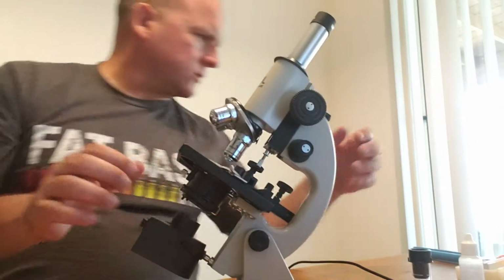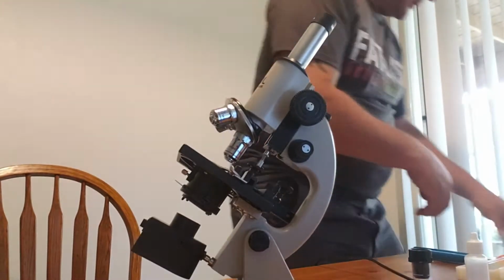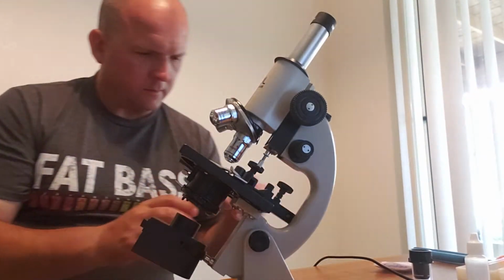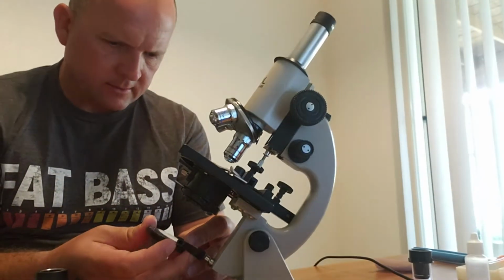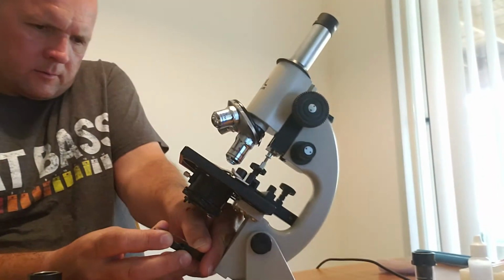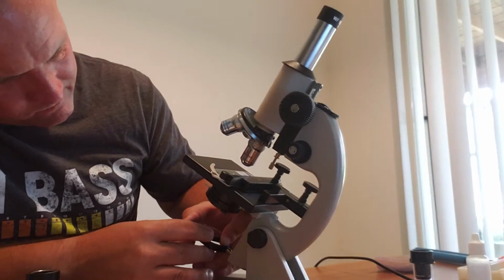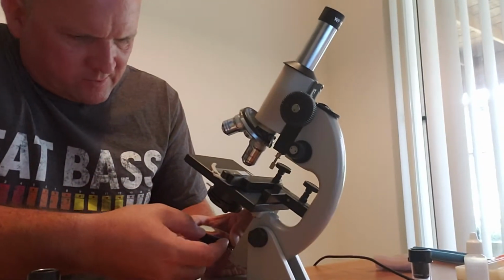You have the light source, or I have a mirror that I can place on here, which is, there you go.